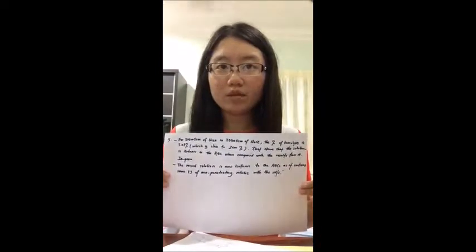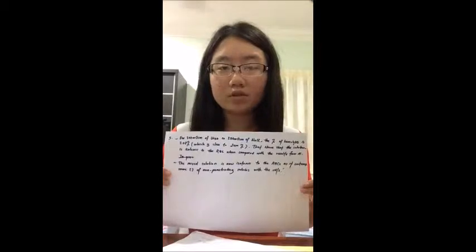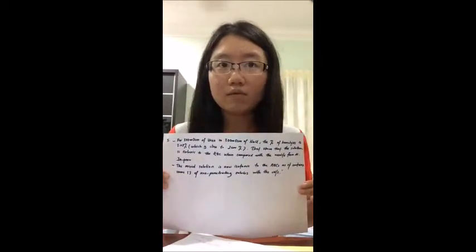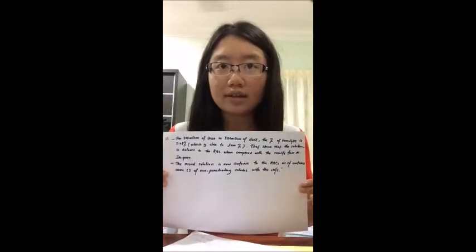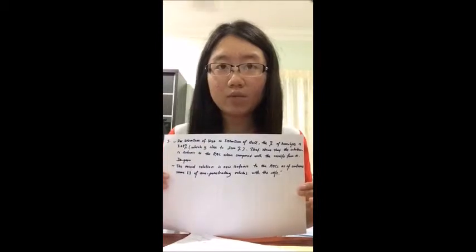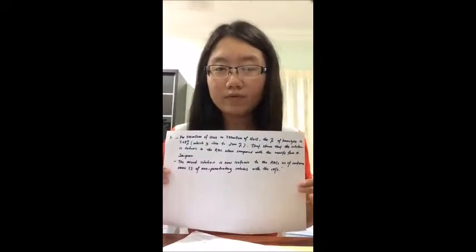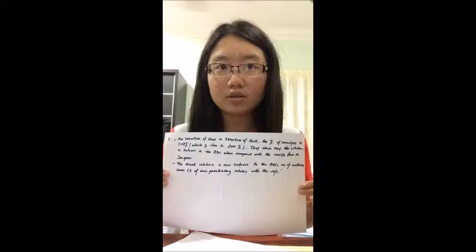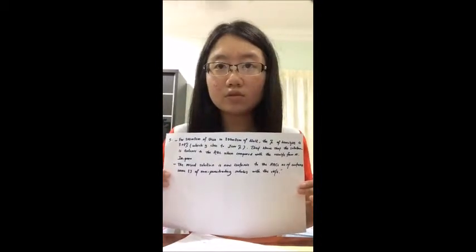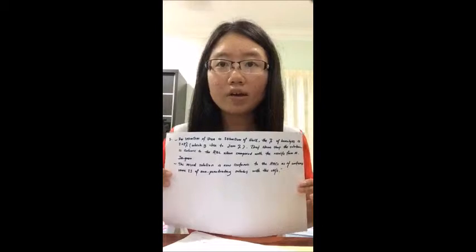For the 300 milliosmol of urea in 300 milliosmol of sodium chloride solution, the percentage of hemolysis is 3.08%, which is close to 0%. That shows that the solution is isotonic to the red blood cells when compared with the results from A1. In the previous experiment, we proved that sodium chloride is a non-penetrating solute, while urea is a penetrating solute. As a result, the urea tends to move into the intracellular fluid. The mixed solution is isotonic to the red blood cells as it contains the same concentration of non-penetrating solutes as the cell.